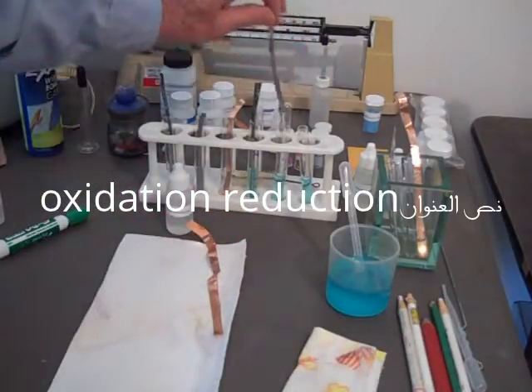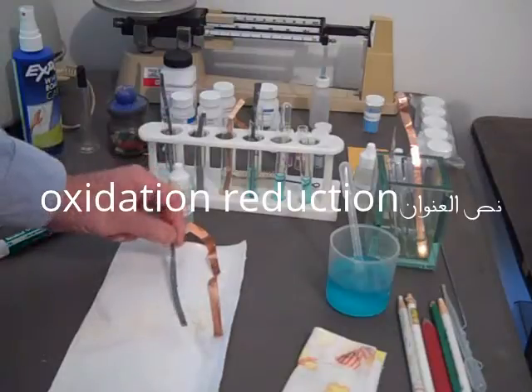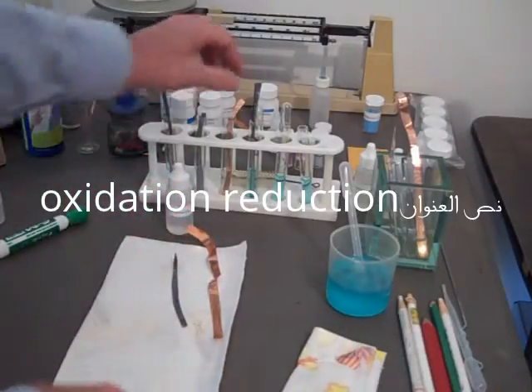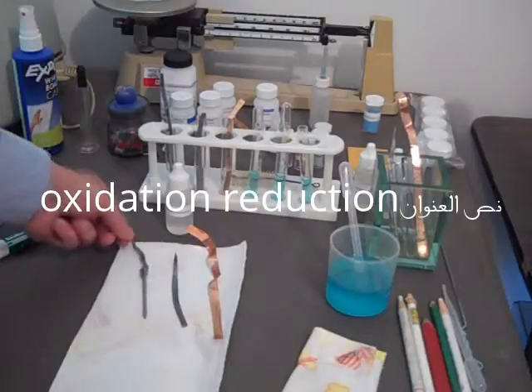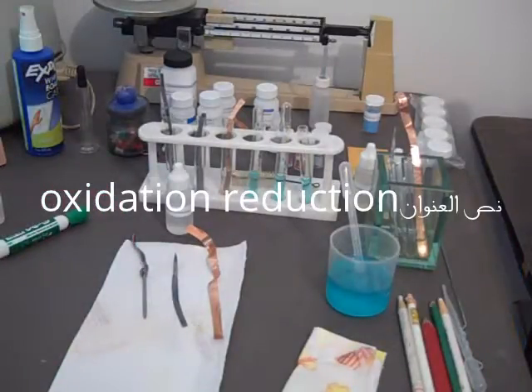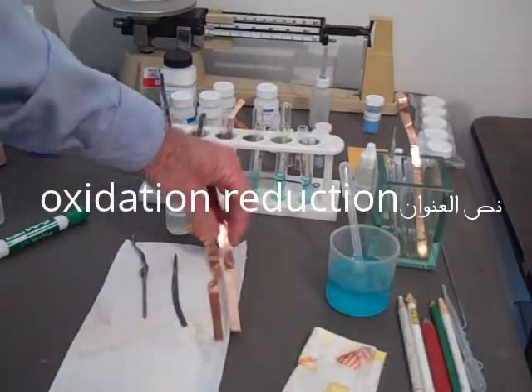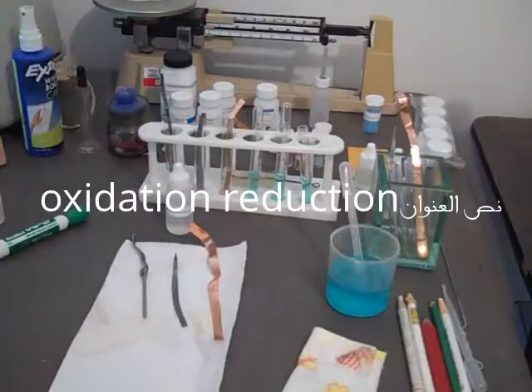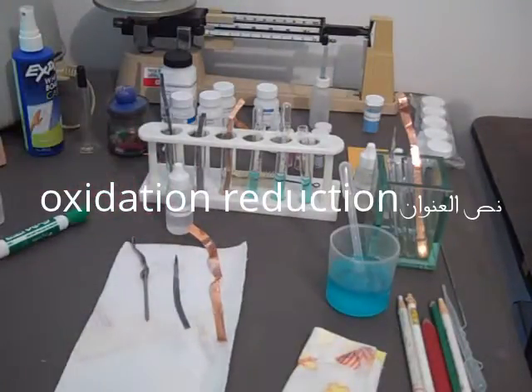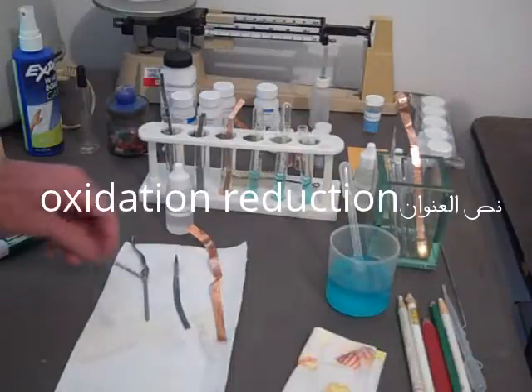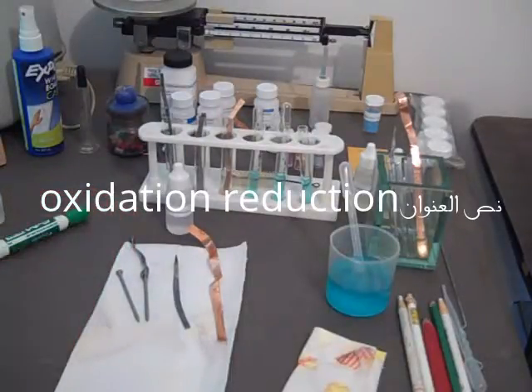Here's the piece of copper. Nothing has happened to the copper at first glance. Here's the lead. You can see the lead is really brown—it darkened quite a bit. And here's the galvanized nail, and I actually don't see much change in that. We'll compare them with the bright copper. It hasn't been treated at all. And the lead. And you can see the lead has really changed. And the galvanized nail. There's some darkening on the galvanized nail, not much.